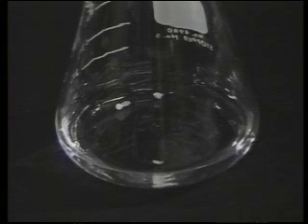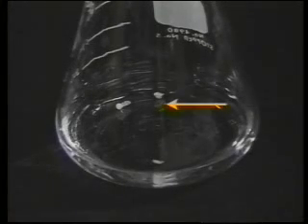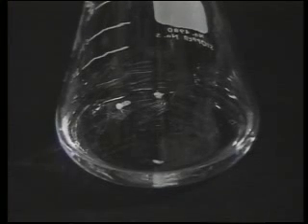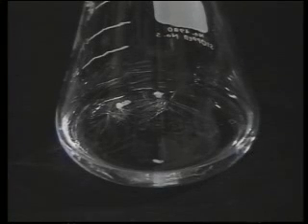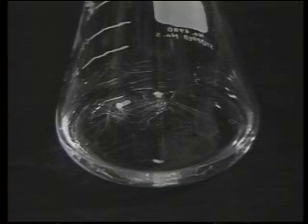Now you are ready to cool the solution, causing the compound to crystallize and leave soluble impurities in the solvent. Remove the flask from the heat and place it on the bench. Leave it undisturbed until the temperature of the solution approaches room temperature and crystals begin to appear in the flask. The size of crystals that form varies with the rate of cooling. Rapid cooling tends to form very small crystals and may also precipitate the impurities out of the solution along with the small crystals. During cooling, it is very important that some crystals have begun to form before putting the solution into the ice bath.